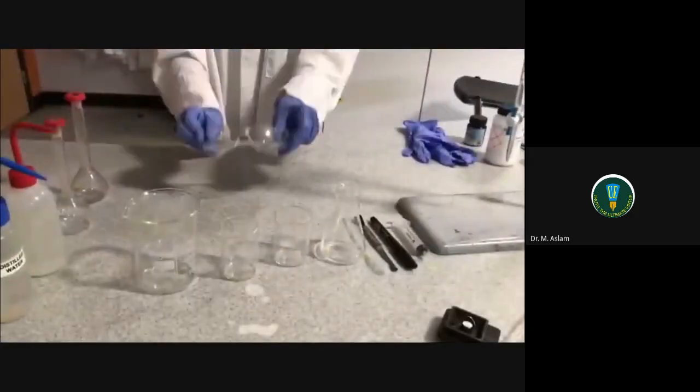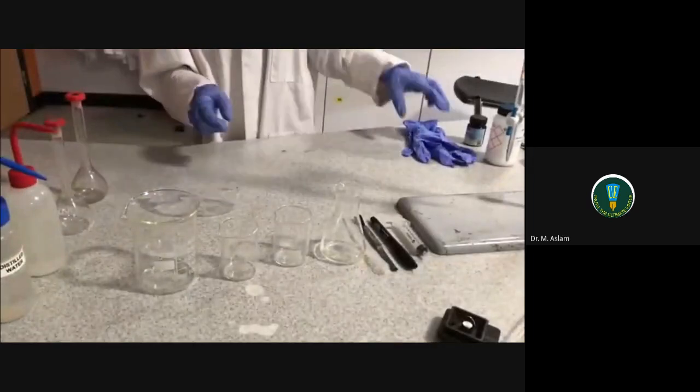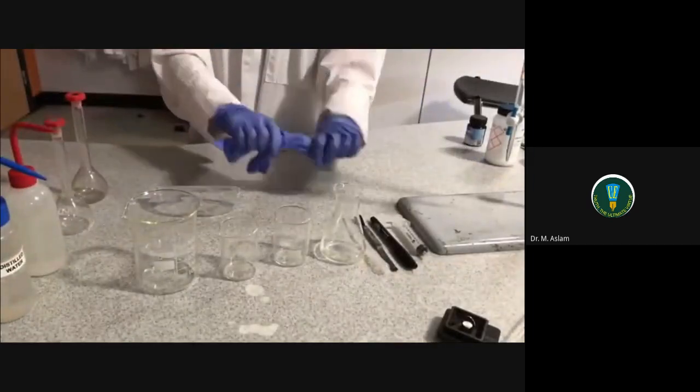This is a demonstration to show how to do a titration to analyse the vitamin C content of L-ascorbic acid, which is a vitamin C solution. Please use the personal protection equipment provided as directed by your tutor.